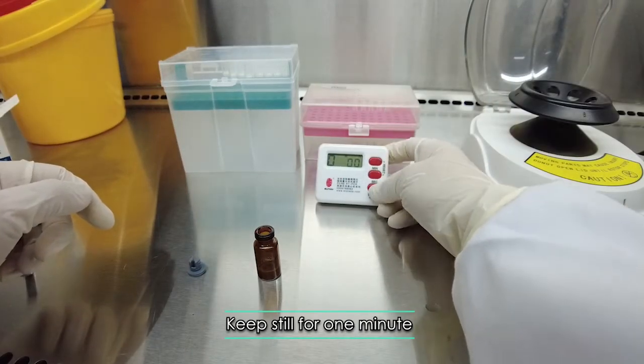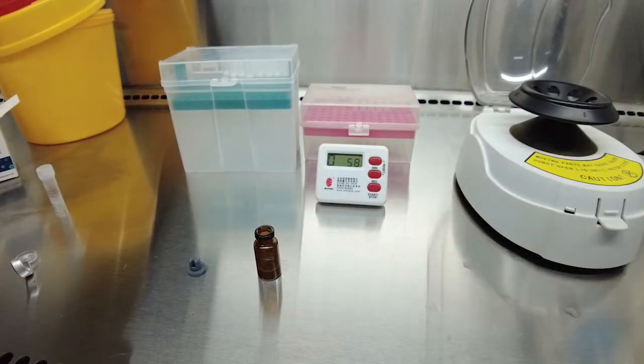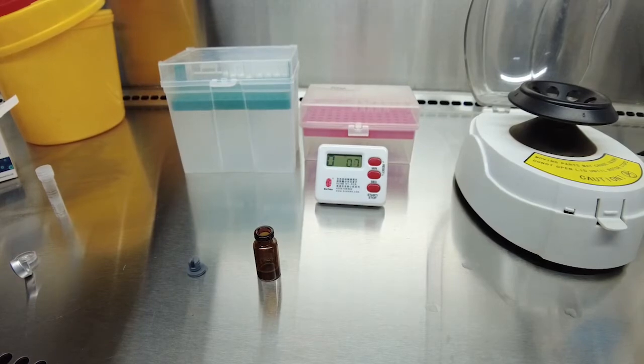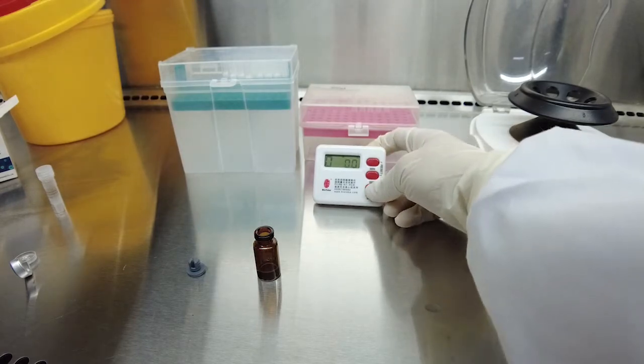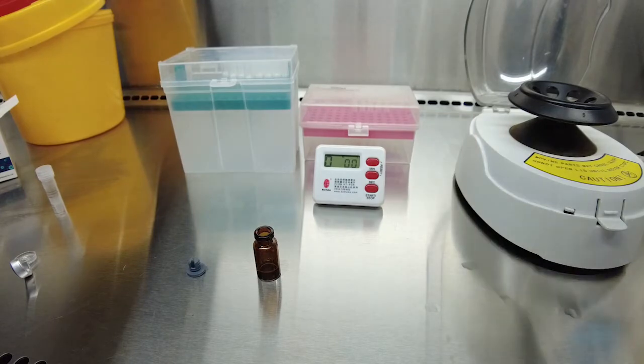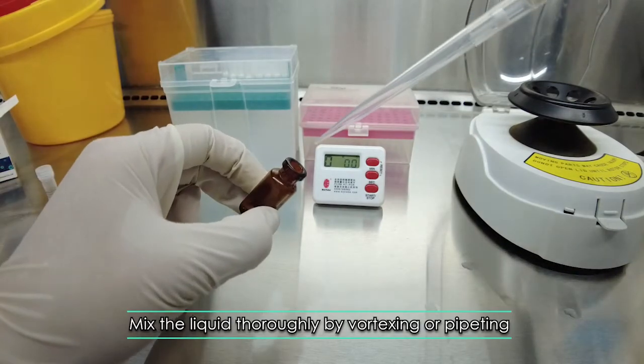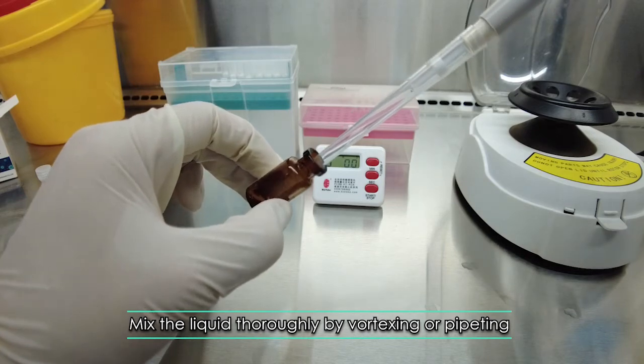Keep still for one minute. Mix the liquid thoroughly by vortexing or pipetting.